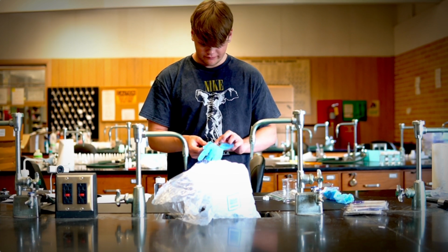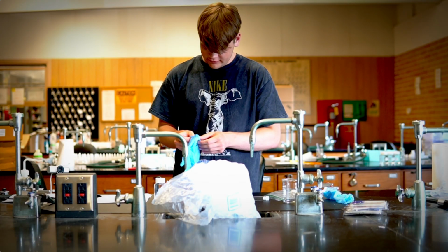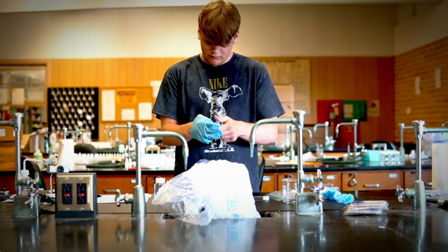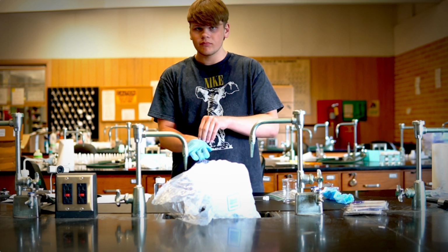So in our setup, in addition to what we need, we definitely are going to need gloves and goggles as always, right? Always need gloves and goggles no matter what. Okay, so we're going to get started with gloves and goggles, making sure that we have everything we need, and then we're just going to get started. All right, so to get started, put on your gloves, put on your goggles, and start putting things into your solution.